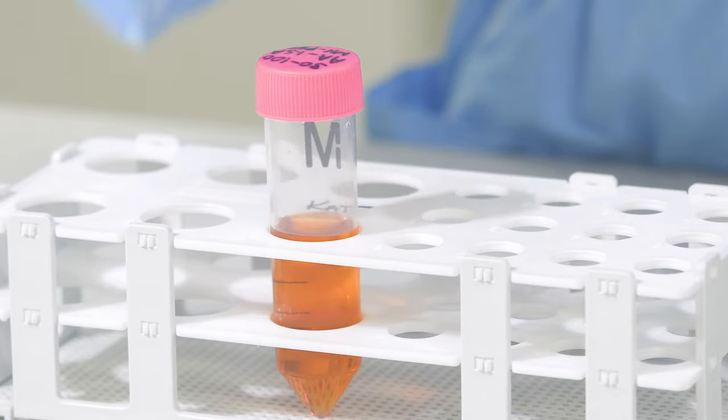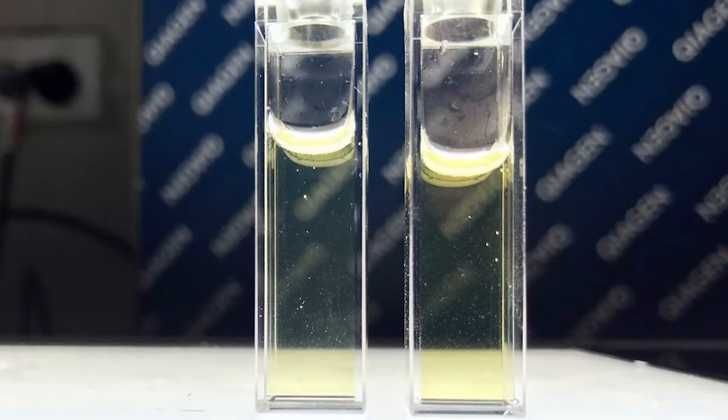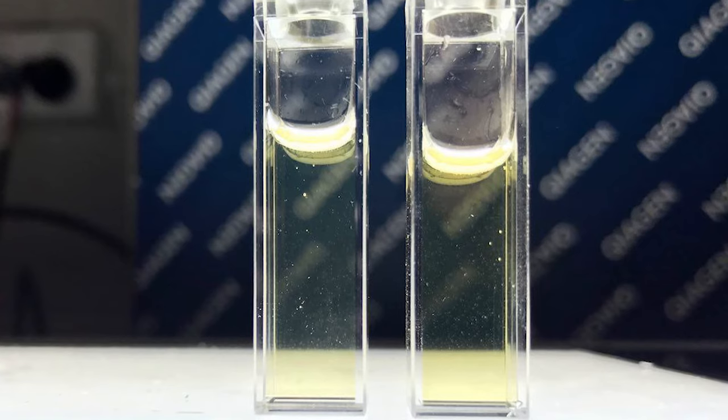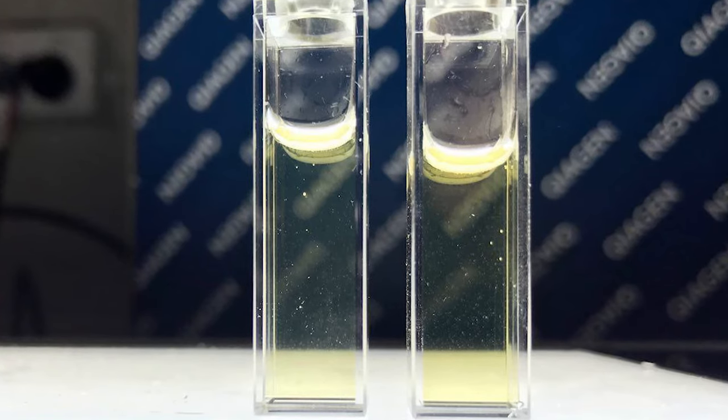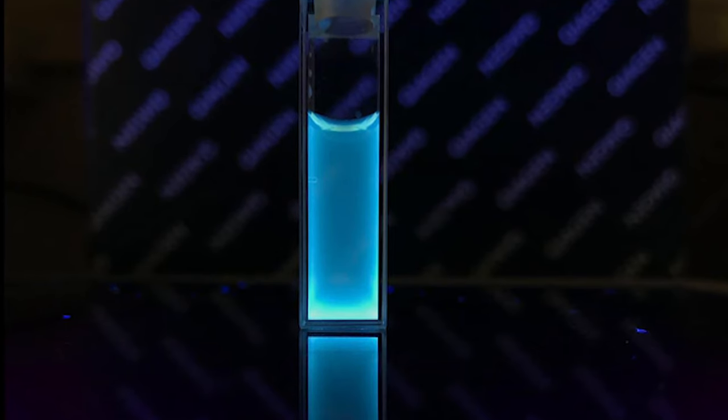Now you can view them under a UV lamp and see how they fluoresce. This is how they look like under normal white light. And then I have used a UV lamp to see what the carbon quantum dots will do when I expose them to UV light. Wow! You can see now they are shiny and glow like a star. So, now we can see just how tiny these nanoparticles are.